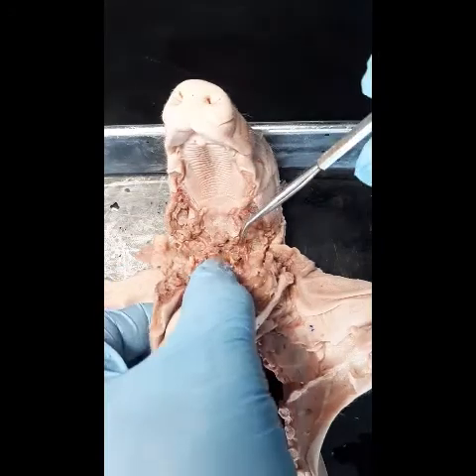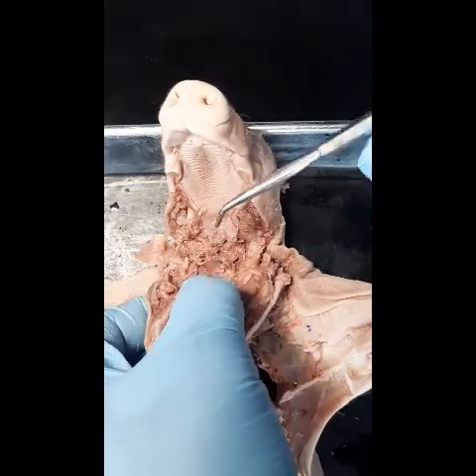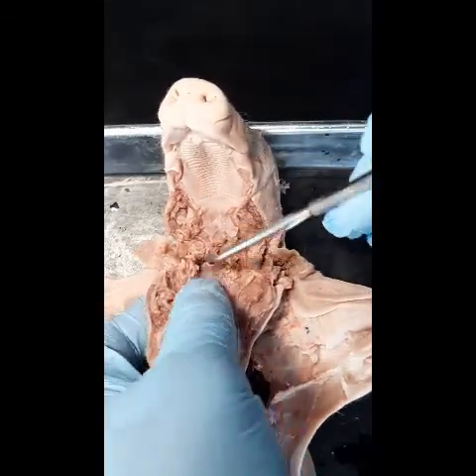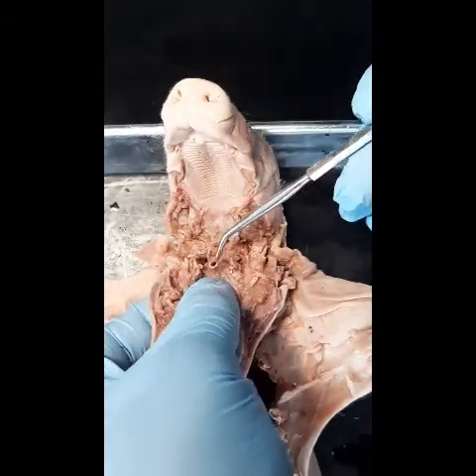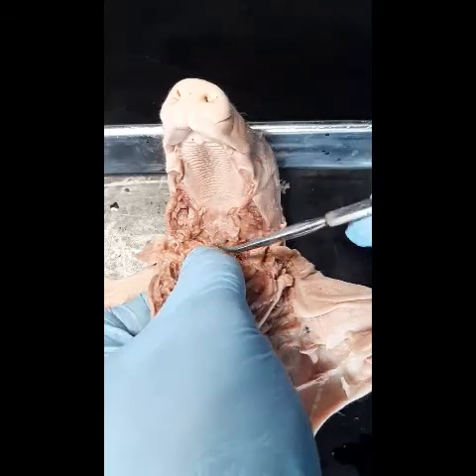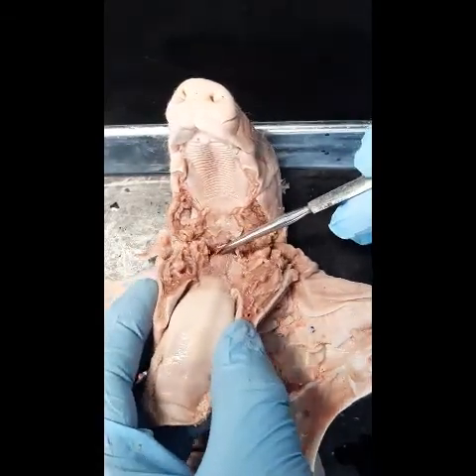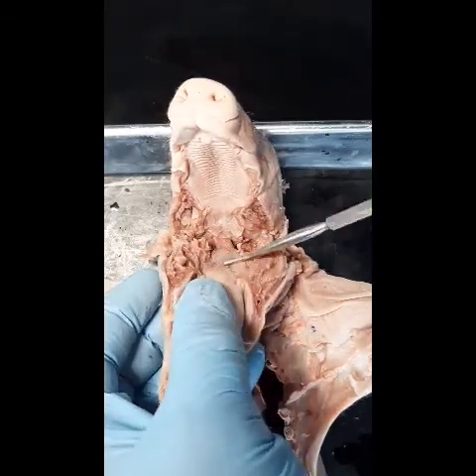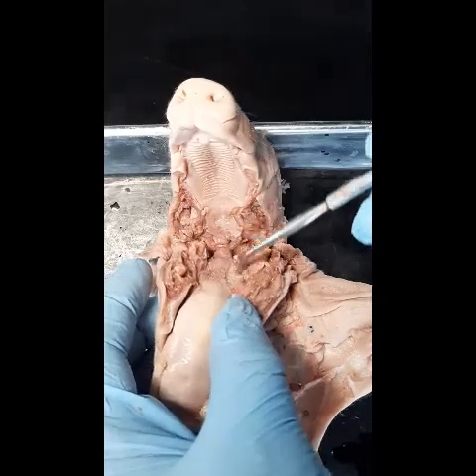Air would travel from the nasopharynx to the oropharynx to the laryngopharynx and eventually into the larynx. This is the epiglottis, and the epiglottis forms a protective barrier to prevent food from getting into the air passageway. When we are swallowing food, the epiglottis would close the opening of the larynx to prevent food from entering.